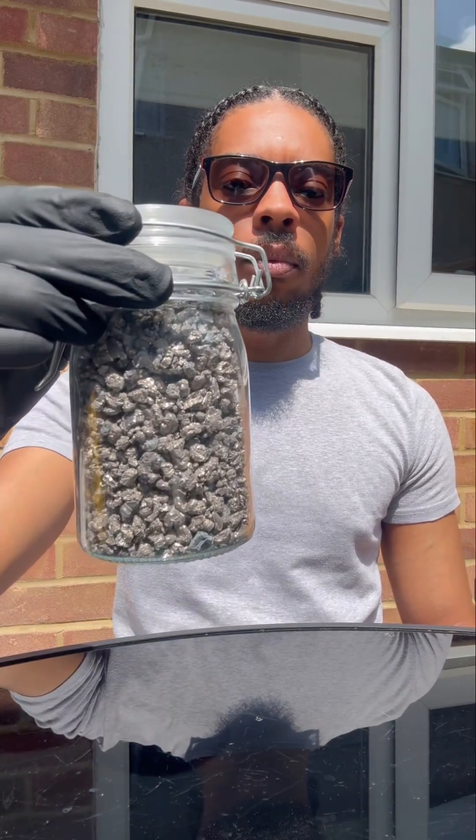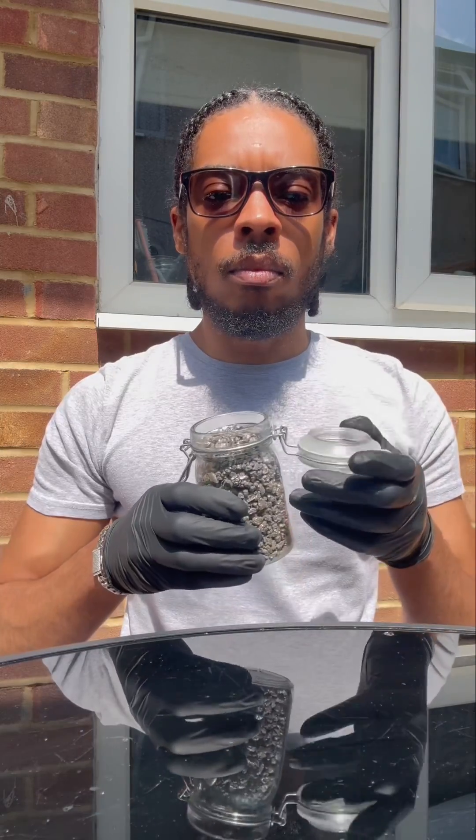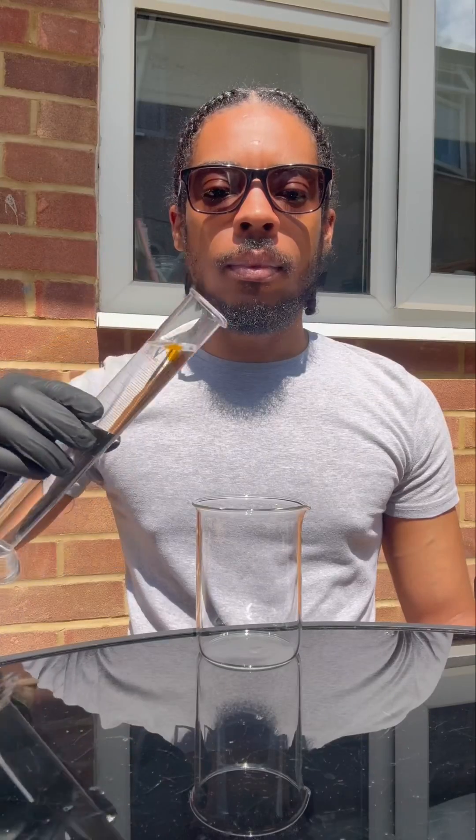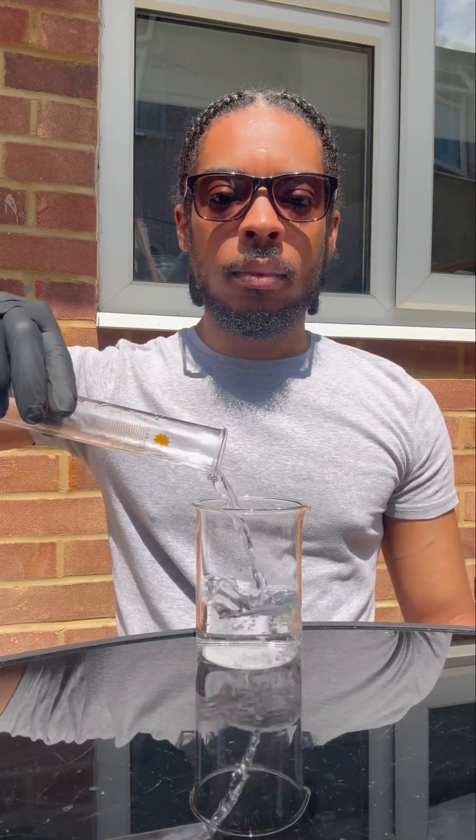Alright, boom. Man's got some pure calcium metal here. Now calcium is a shiny silvery metal that reacts violently in water. I'm gonna slap it in some water now and see what's going on, but first we're gonna measure the temperature.